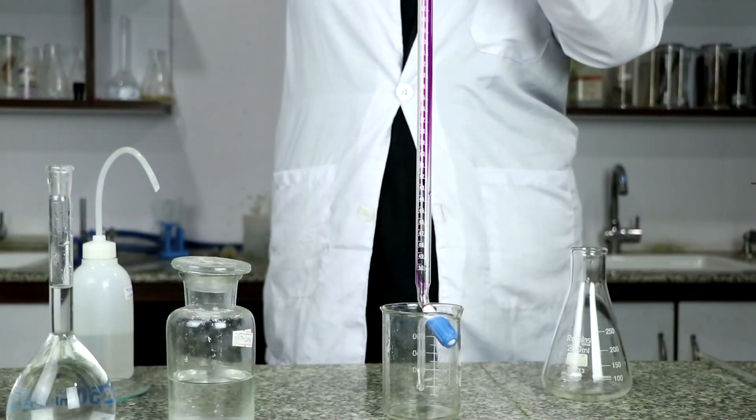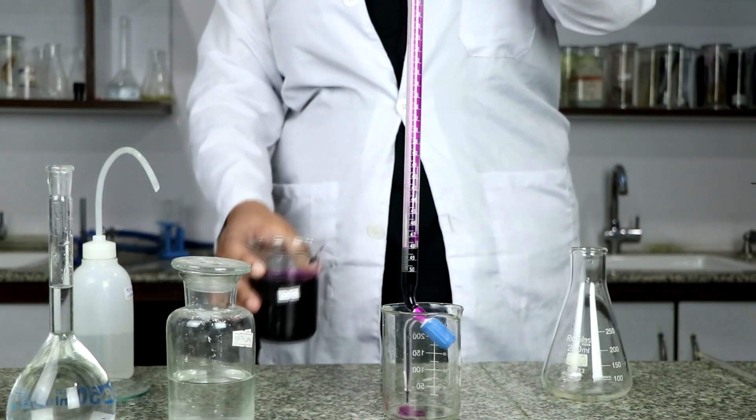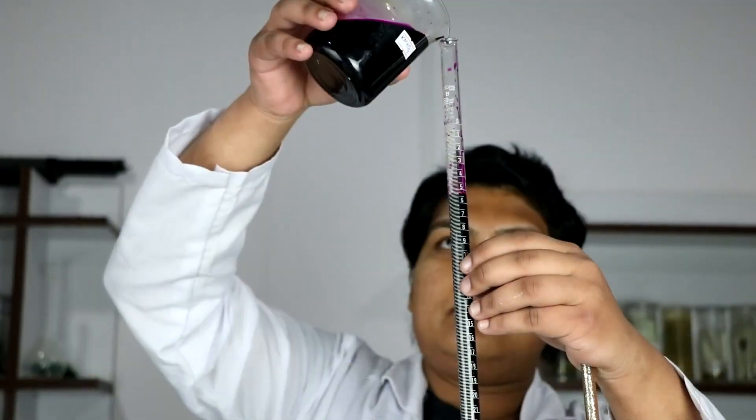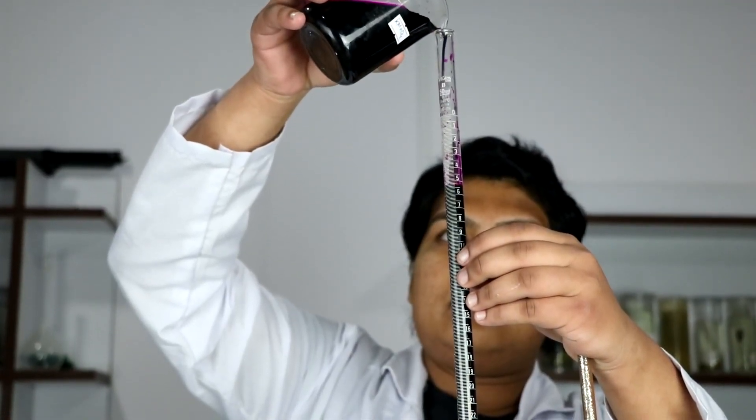Now wash all the remaining apparatus with water. Then slowly rinse the burette with the given KMnO4 solution and fill it with the same solution until the upper meniscus.